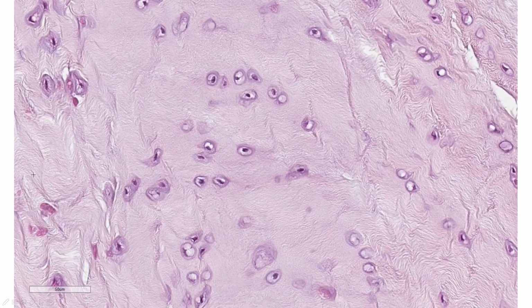Honestly, I usually get a laugh out of students when I ask what does this most remind them of. The reason is because not everyone sees it the way I do, but when they do, they can't unsee it. To me, this looks like an image from Google Earth. Now, don't go wasting time on Google Earth when you should be studying, but sometime go check it out.